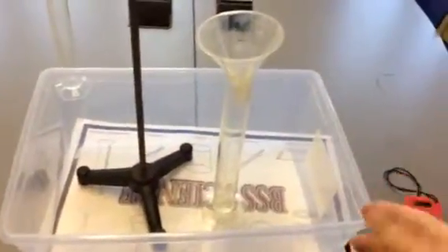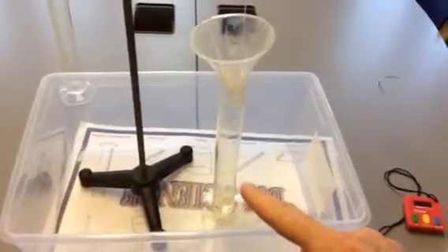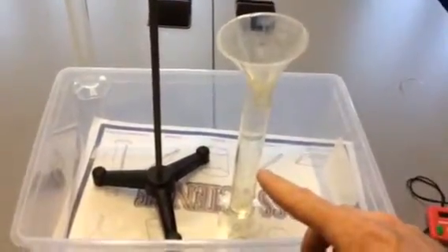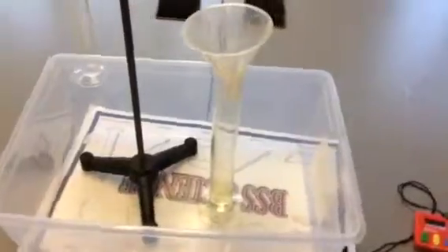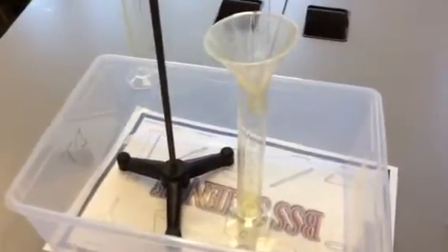Oil is pouring out into the graduated cylinder. You can see as it's coming up and up and up. I'm not going to do the whole trial here with you, but you can imagine that once it gets up into this area here, it'll be about 50 milliliters. And actually at precisely 50 milliliters, you'll say stop, and you'll have some data to record. Hopefully you'll have enough time to get 2 trials in per each temperature range. Okay, that's it for this video.